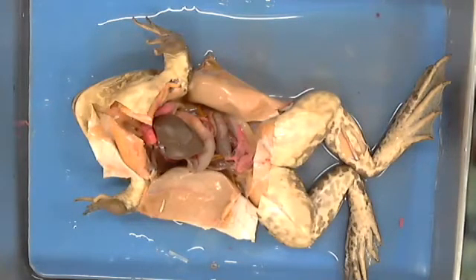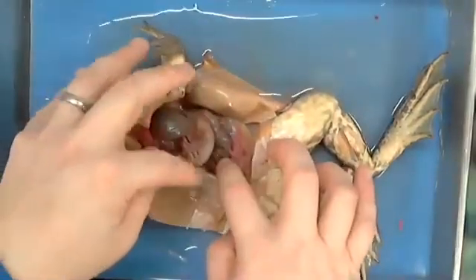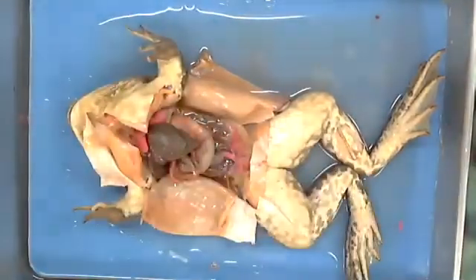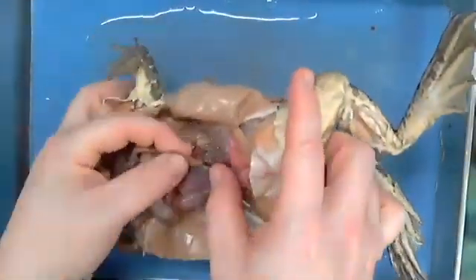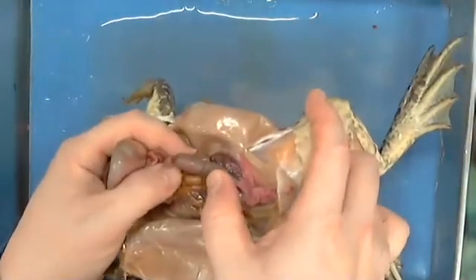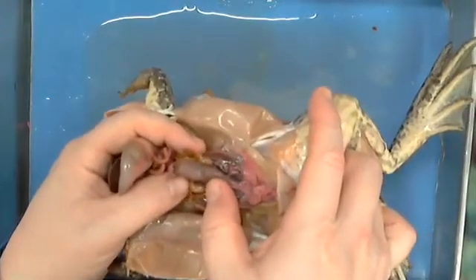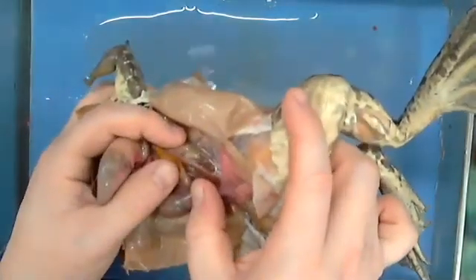And by the way, if you'll notice on your actual picture, right? If you wanted to see, I'll show you. Here is this part of the bean that's part of the actual fat body. So this is a testes. Same thing on this side over here, right? The fat bodies are not always part of his testes. They just happen to be located here. Fat bodies are just storage places. But this brownish looking bean that exists here and here are his testicles, right?